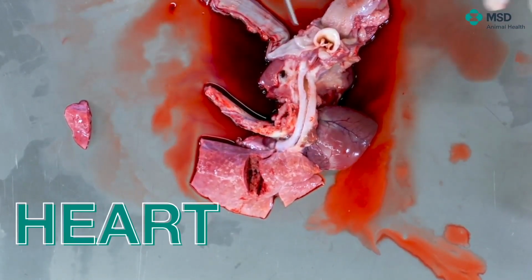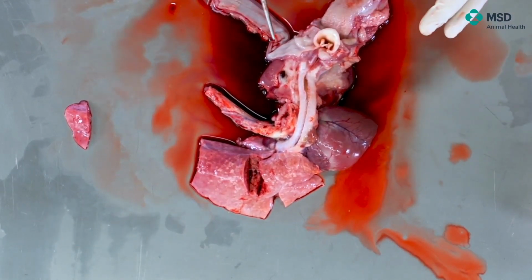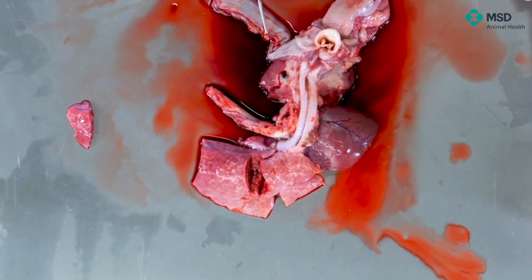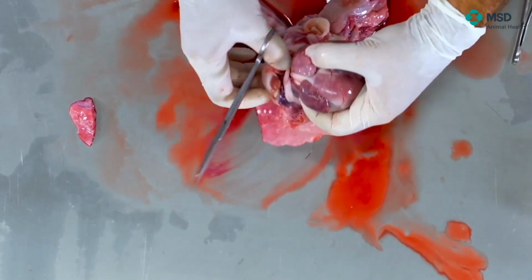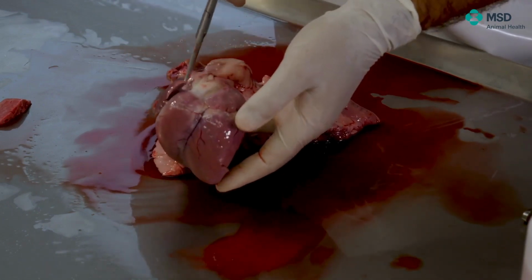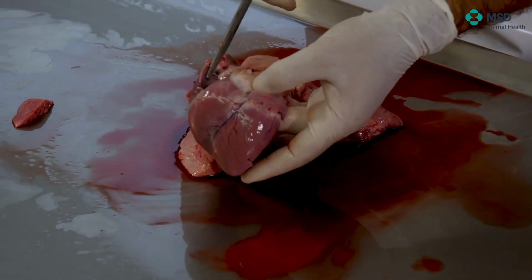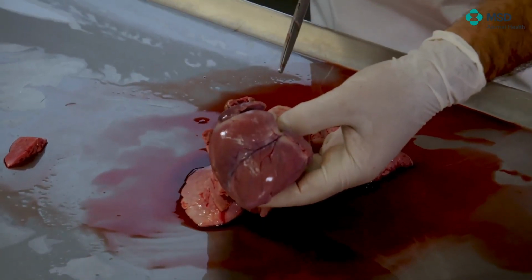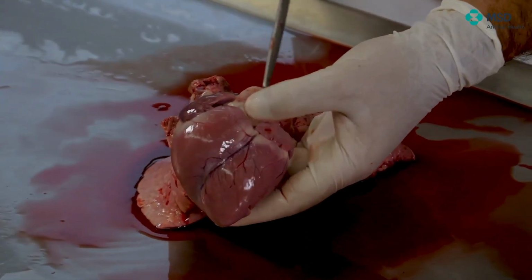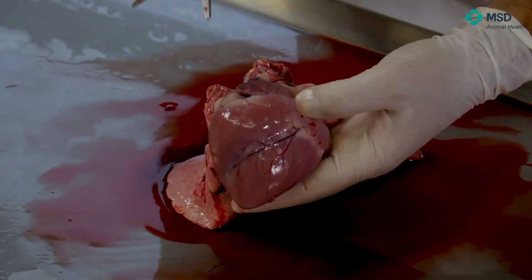And with the heart, as I told you, we used to leave it here, especially in order to see if there's any type of potential affection of the big vessels. In general terms, this is not the case in pigs, but that way we can look at it, and we still have the lungs here, so it's relatively easy to manipulate. How do we open the heart? The easiest way is always to follow the blood flow.